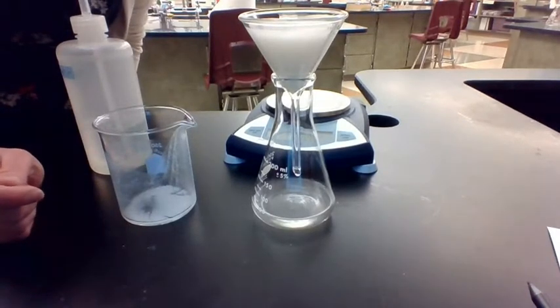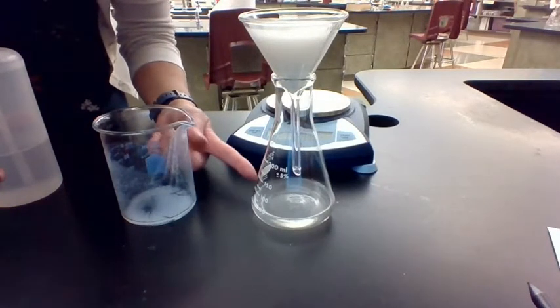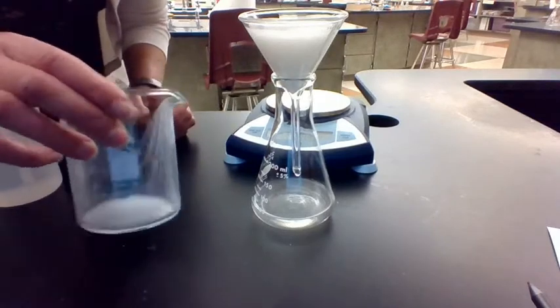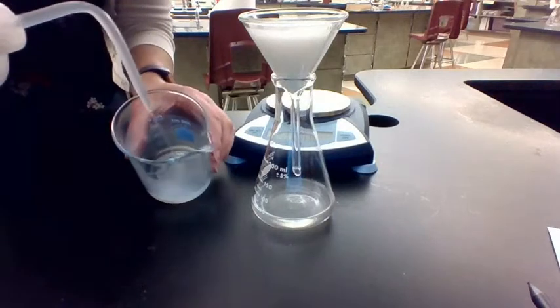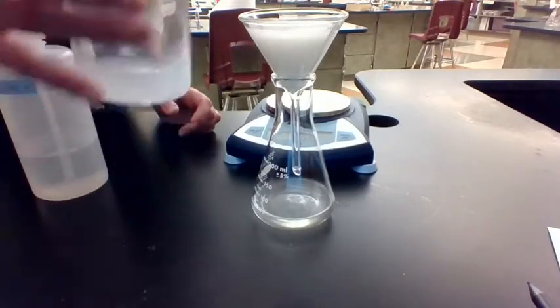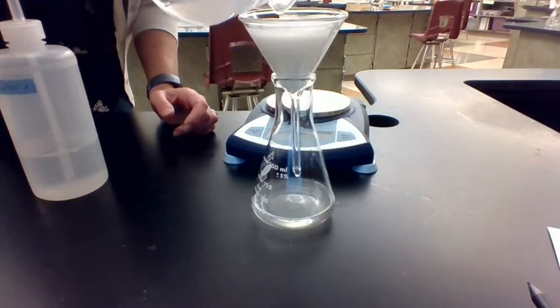Okay, we are back and we have filtered most of our solid. Notice that the bottom looks nice and clear, so that's good. That means that all the solids stayed stuck up here and none of it made it through. Notice how our beaker, this is where everything was just a moment ago, is still kind of cloudy. That tells us that some solid is still remaining in the beaker. So an important step here experimentally is we've got to add some water and make sure we get everything out of the beaker. So we want to make sure we completely transfer everything there.